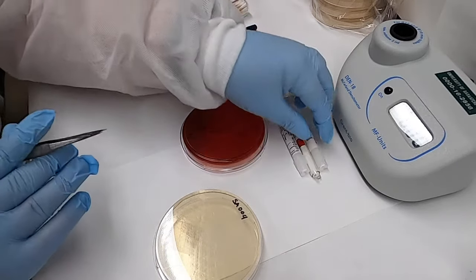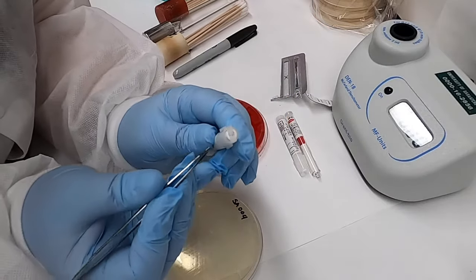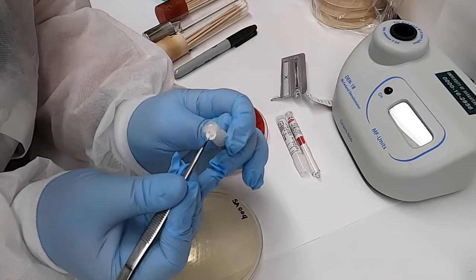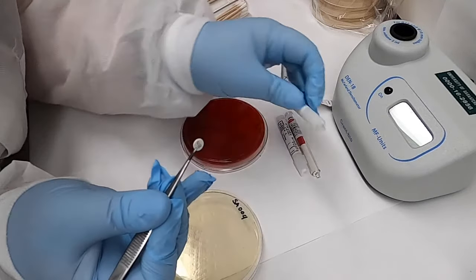We're now ready to place our antimicrobial disks. We remove individual disks from their cartridges using sterile forceps, which we then use to place each disk on the agar surface.